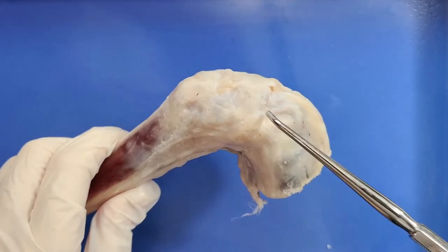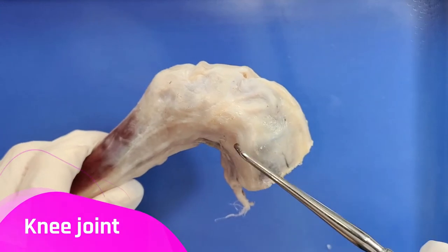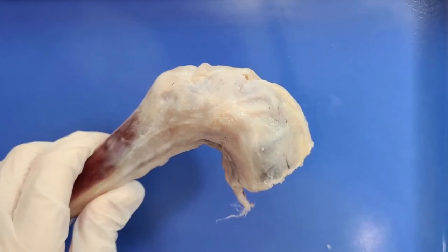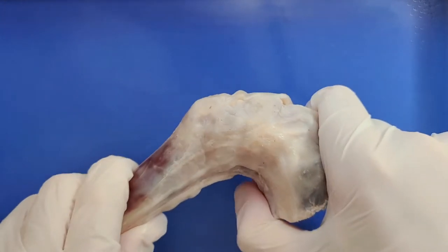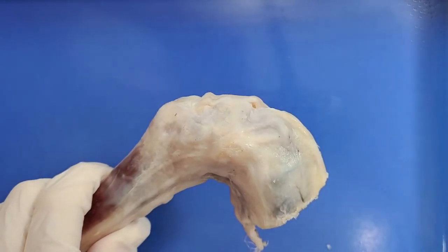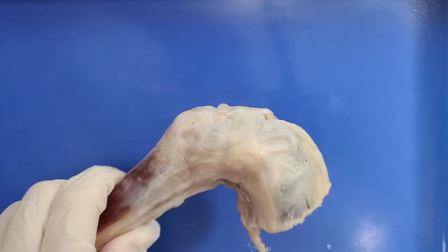So here, this joint between the femur and the tibia is the knee joint. The knee joint is a hinge joint, meaning that it allows the leg to extend and bend back and forth. It's comprised of bones, cartilage, ligaments, tendons, and other tissues.